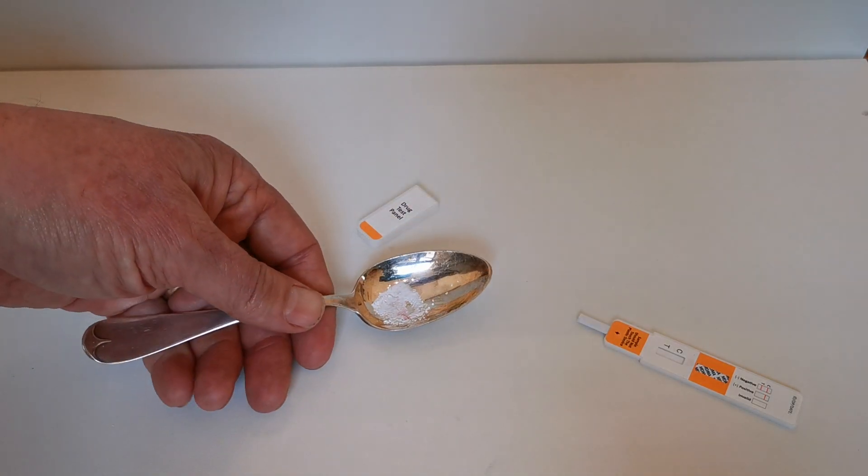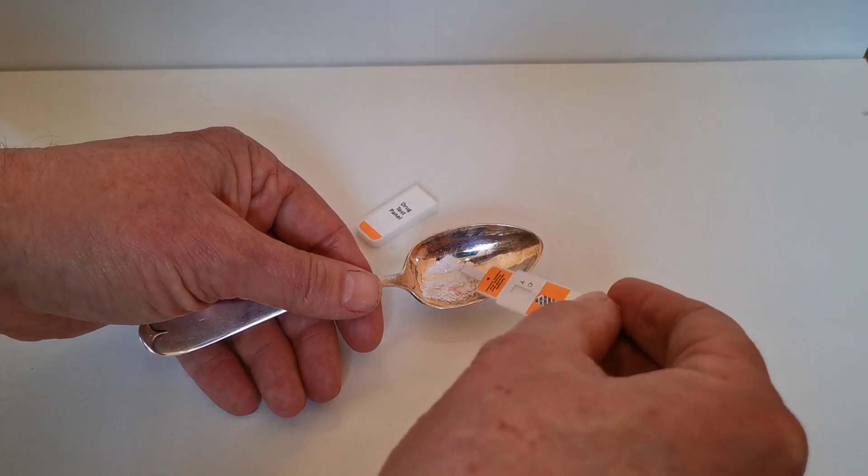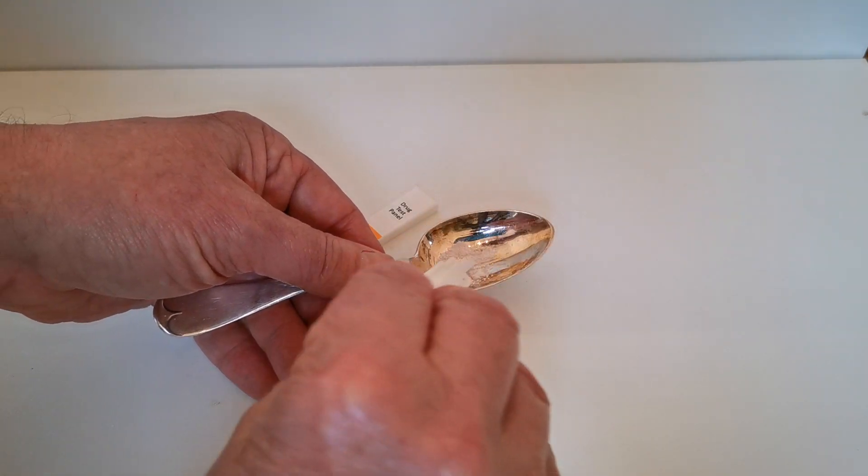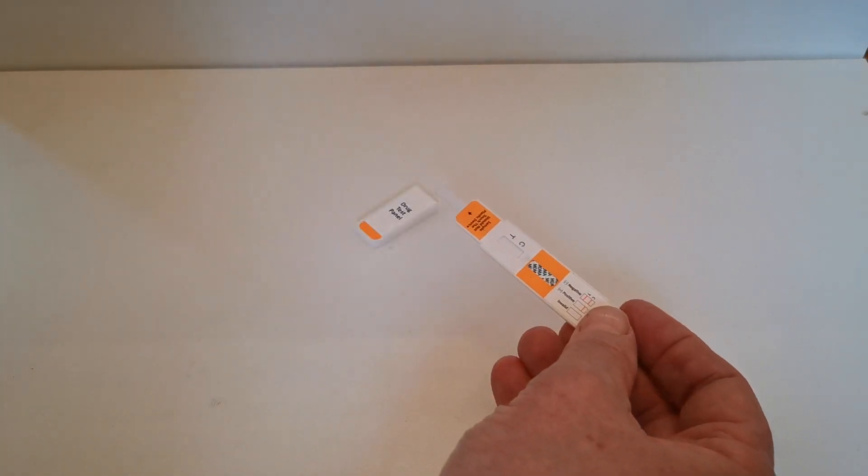And once you're happy with that and you've crushed the tablet that you're wanting to test, again if you just wipe the prong through the powder to build up a deposit of the powder on the test prong, that should be sufficient.